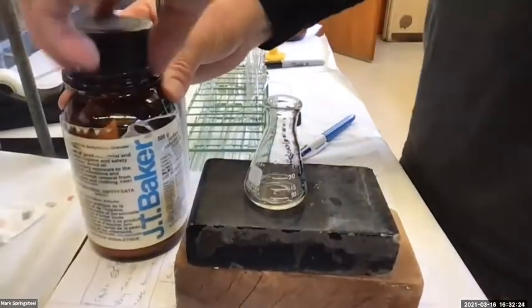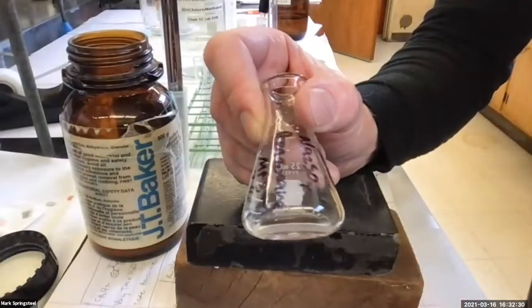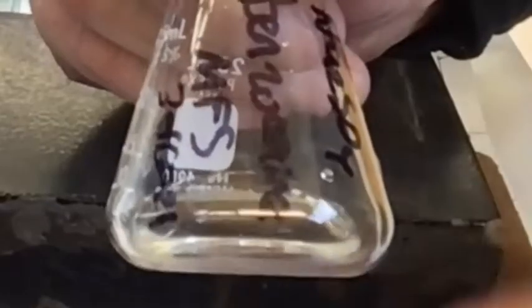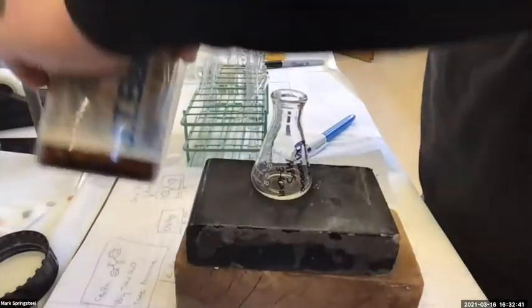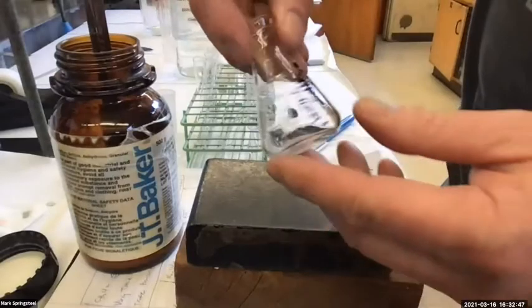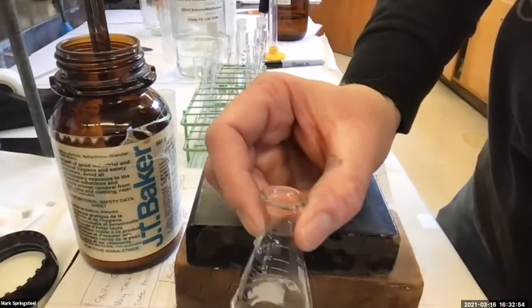And I don't have to measure this out, the sodium sulfate. Oh, also, can you see like beads of water stuck to the outside of this flask a little bit? See that little bead of water stuck there? The little droplet like right there. Yeah. So let's see what happens after I add some sodium sulfate. Swirl it around, and what I'm going to be doing is drying the organic layer. Oh yeah, it's nice big clumps this time, huh? It's pretty obvious clumps.